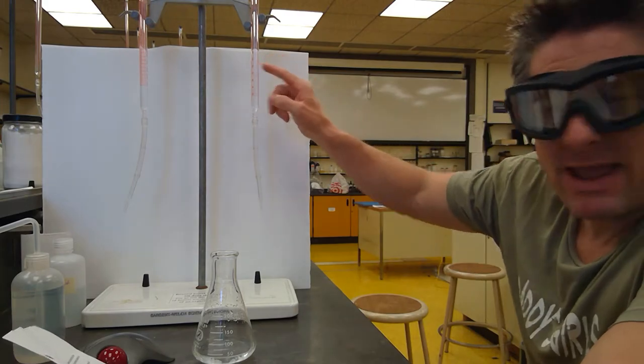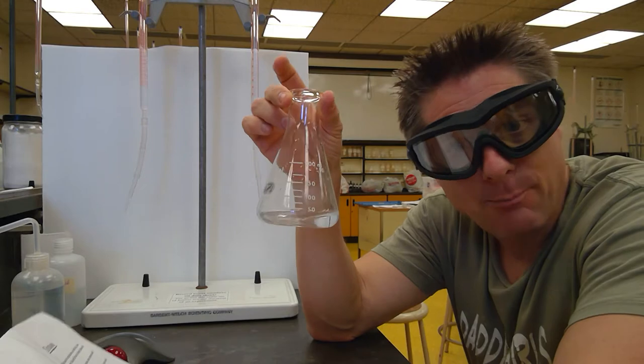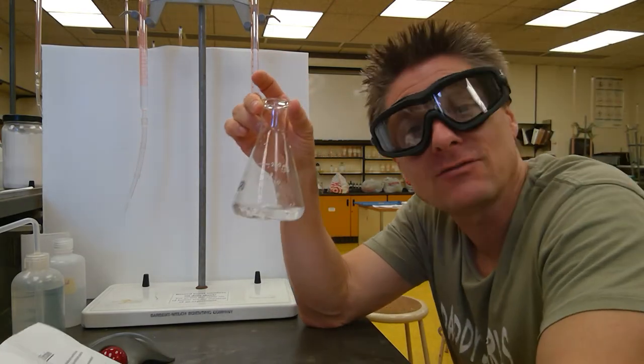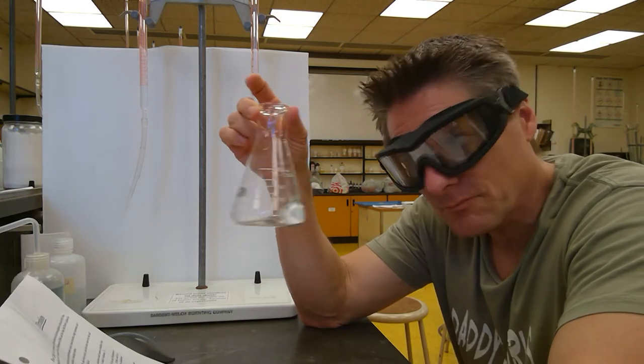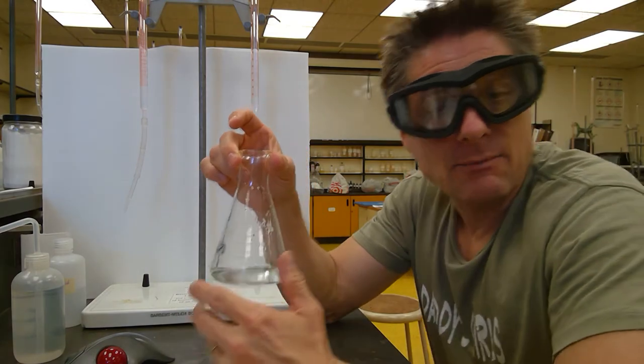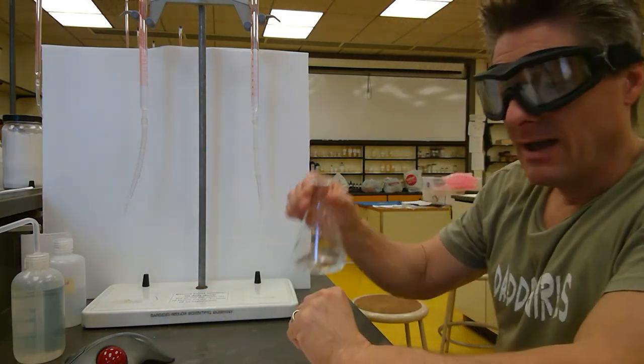So we're going to add this base at the maximum drainage rate of about half a milliliter per second and purposely turn it pink. That seems kind of counterintuitive versus what we probably learned in high school in introductory chemistry. I'm going to get it in at the fastest possible rate I can within acceptable limits and purposely go past it. So I'm not all anxious about it.